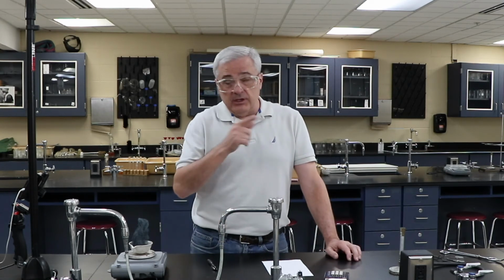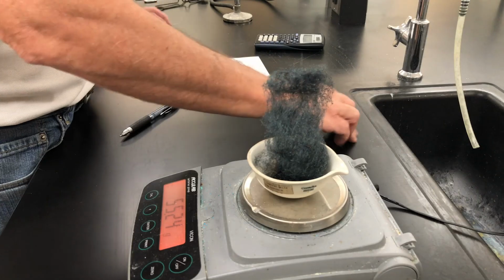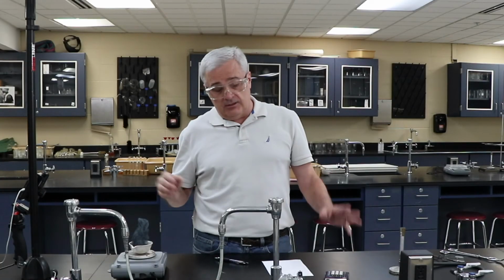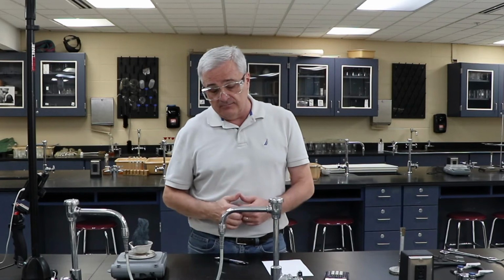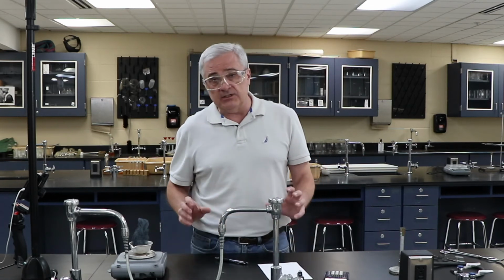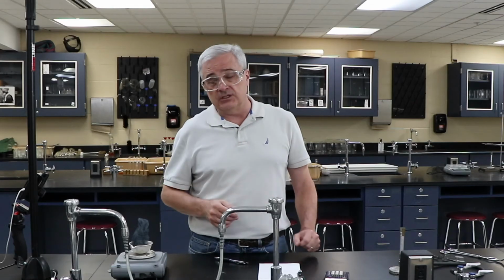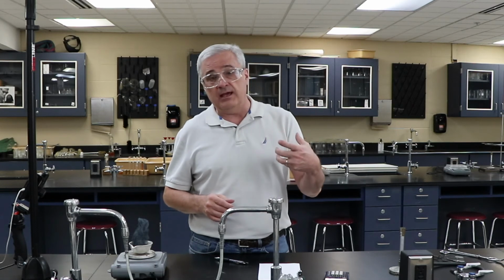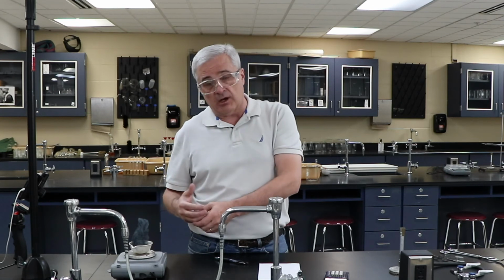We could do that math, but we're starting with so many pieces missing, like this little pile of stuff on the desk, that to do that and to claim any sort of accuracy is kind of overstating the science. But as an exercise, we could take this 0.47, calculate it backwards into how many grams of iron were actually consumed in this process.